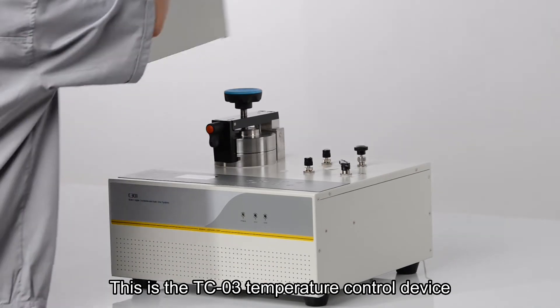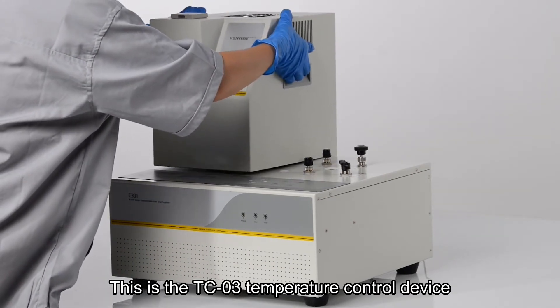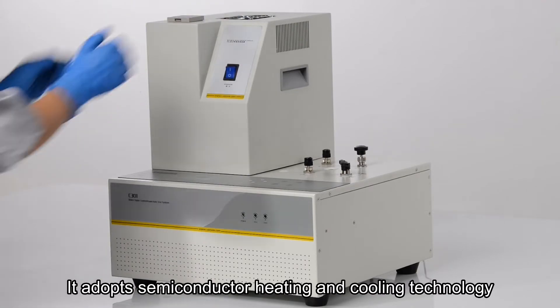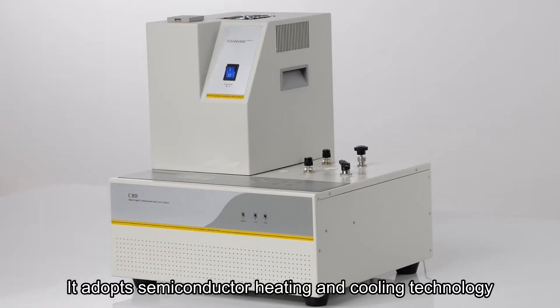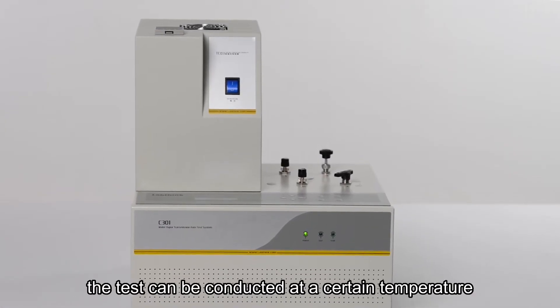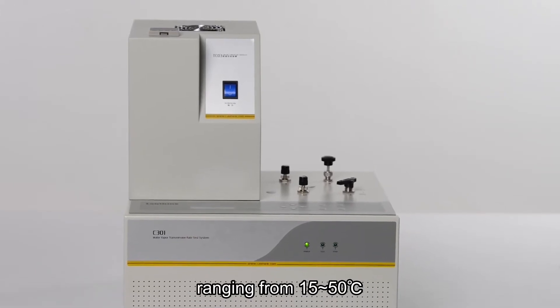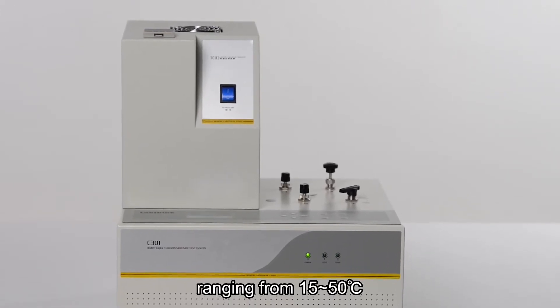This is the TC03 temperature control device. It adapts semiconductor heating and cooling technology. With this device, the test can be conducted at certain temperatures ranging from 15 to 50 degrees Celsius.